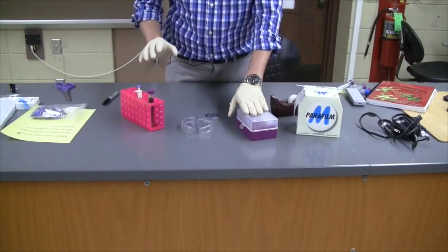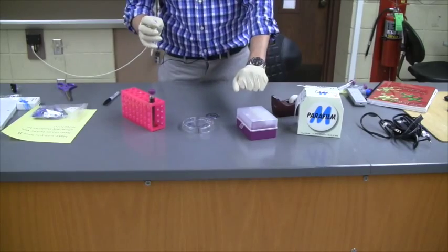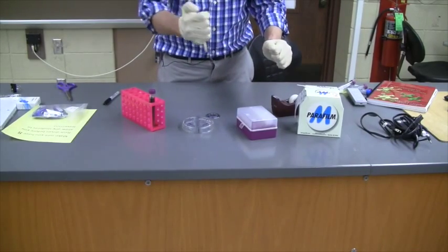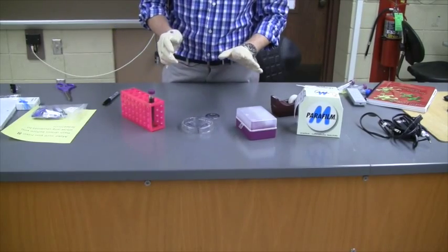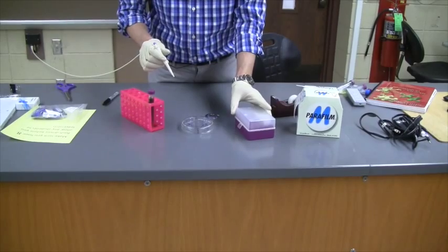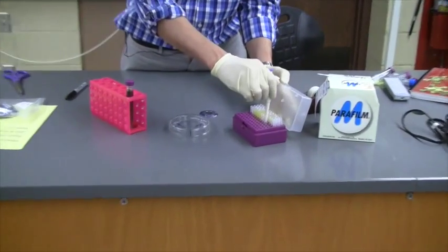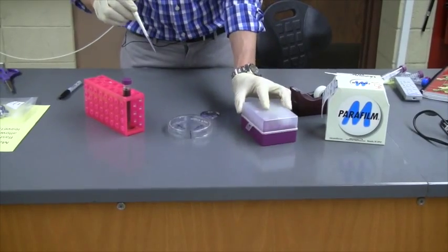Right now these tips in this box are sterile. So I'm going to quickly open and close this box, put a tip on, close the box and inoculate my plate. It may be a good idea to get a second set of hands to do this from your lab partner. Quickly open this, jab the pipette down into a tip, close the box.